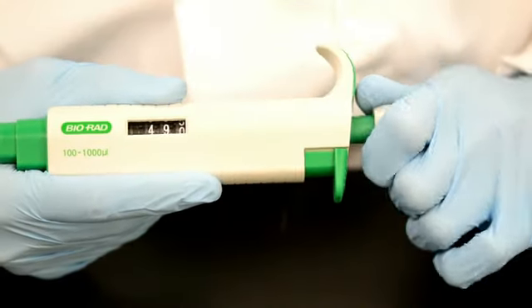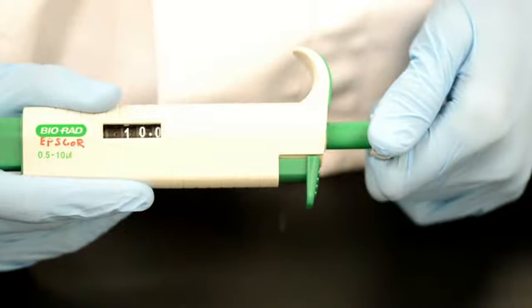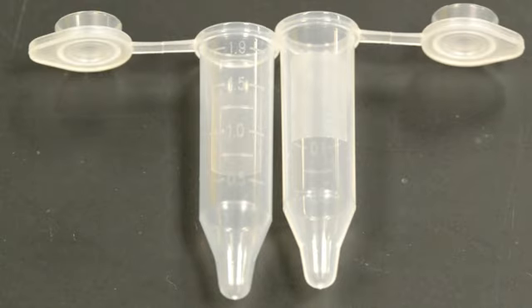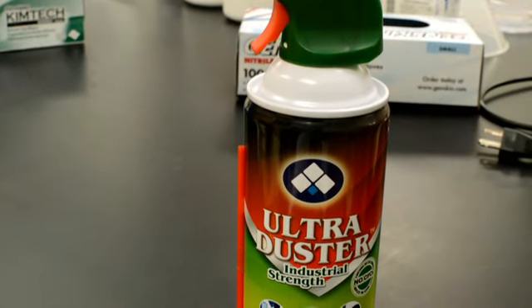One 500 microliter pipette and one 10 microliter pipette with appropriate tips. If you are unfamiliar with how to use a pipette click on the link for a refresher. One 2 milliliter centrifuge tube, deionized water, and compressed air.